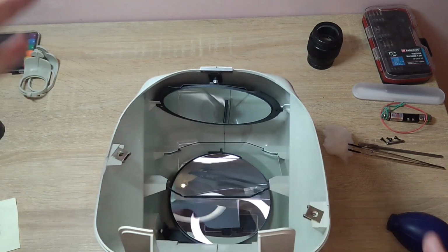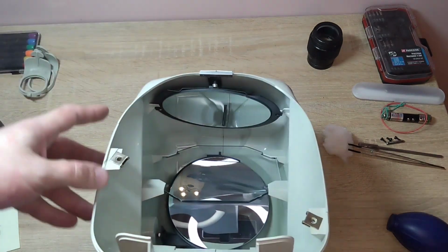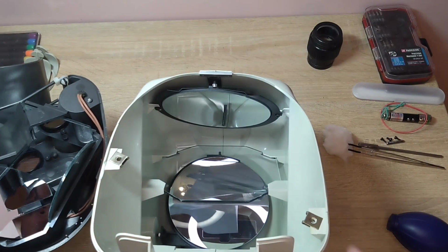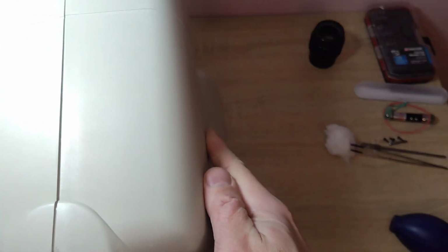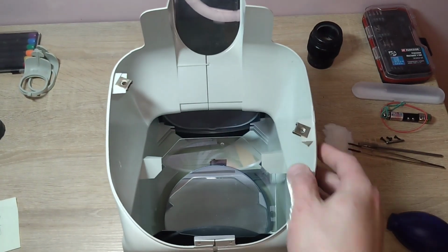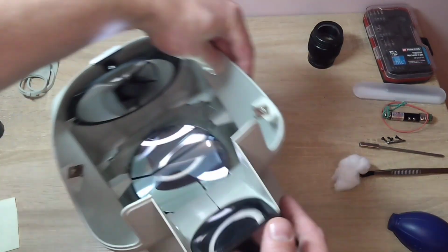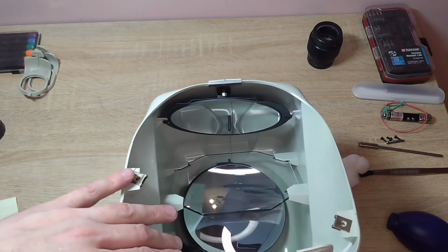I turned this part of the microscope upside down. The image, in this case, actually comes from below, from the mirrors. Well, you understand how it is, like this. So the image spreads upwards from below, as I turned it here. Now it goes from top to bottom. There is one mirror here. At the very bottom, there is a second mirror.